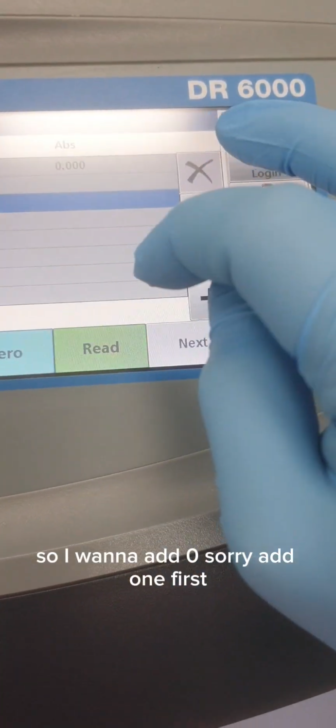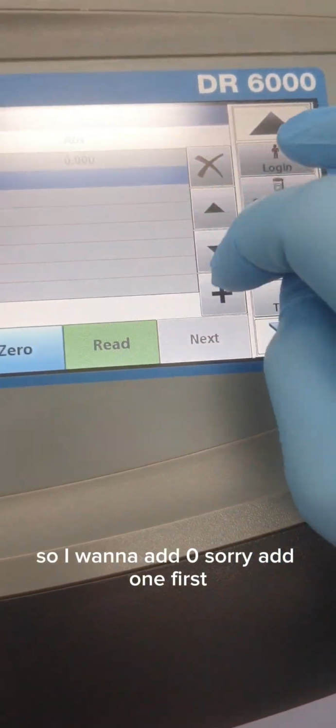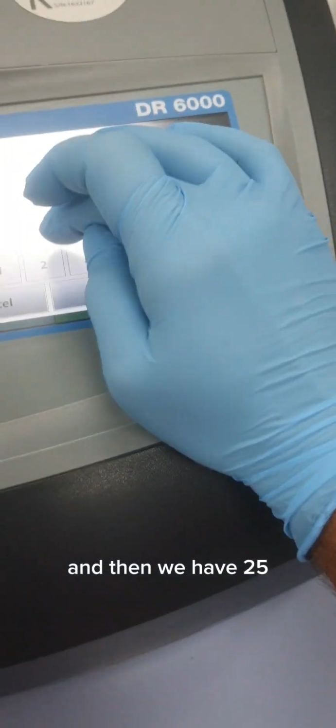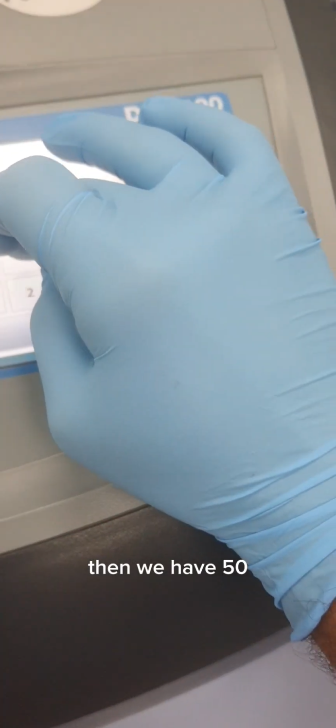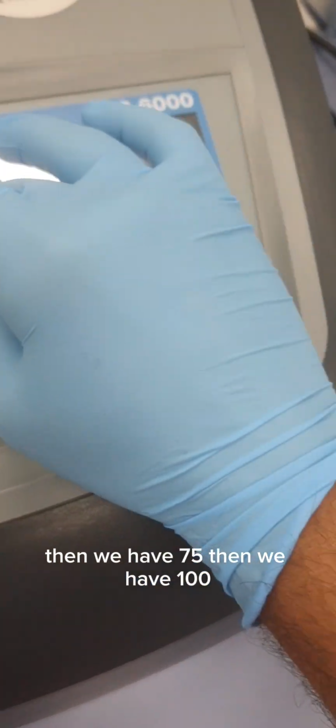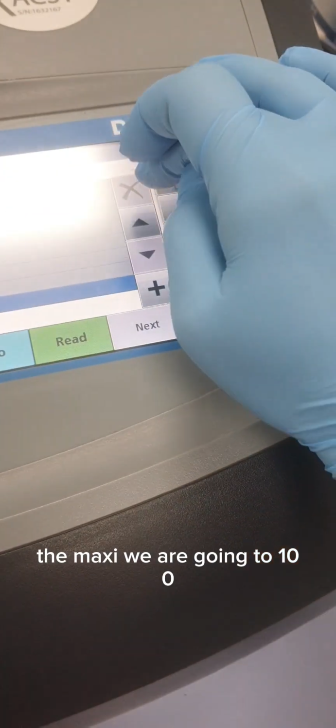So I would add 0. Sorry, add 1 first. Then we have 5, then 10, then 25, then 50, then 75, and then 100. Maximum we are going to 100. Let's start with 0.